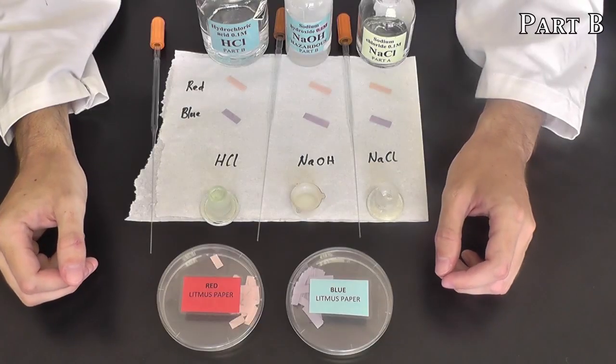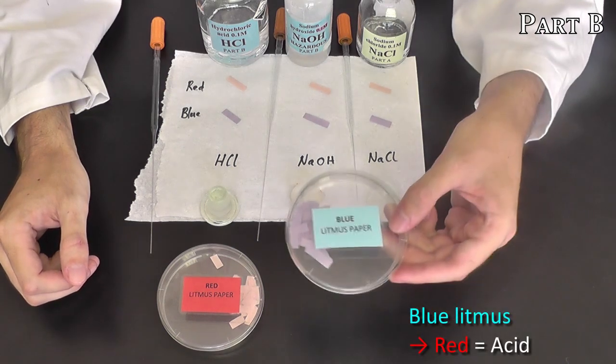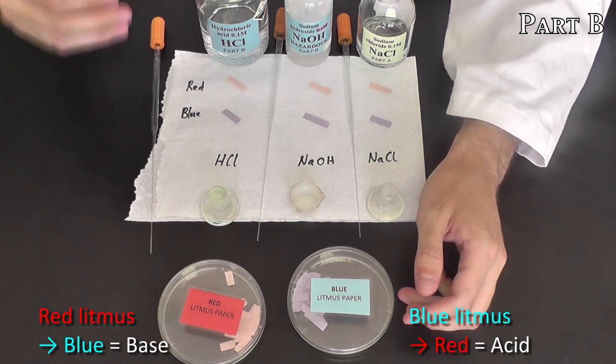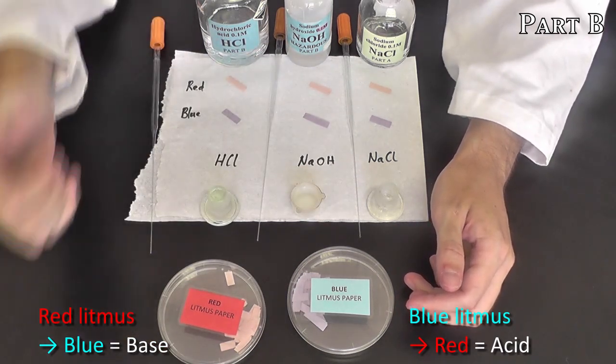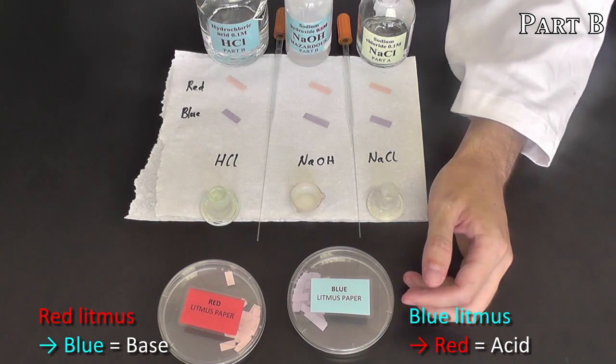Litmus paper can be used to colorimetrically detect acids and bases. Blue litmus paper turns red in the presence of acid, and red litmus paper turns blue in the presence of base. So what I've set up here is a small grid of 3 different chemicals, and by dropping each one onto the red and blue litmus paper, hopefully we'll see which one is an acid or base.